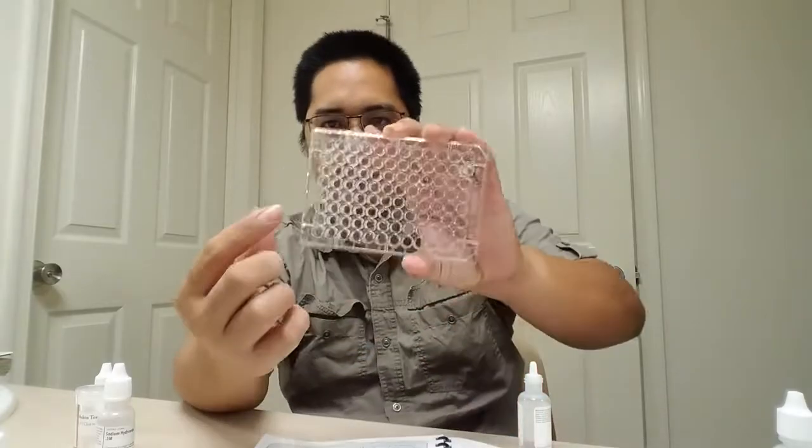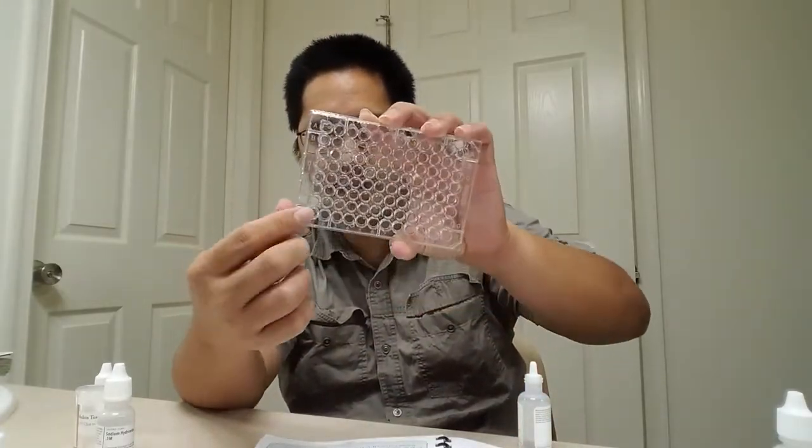All right, here we go. 5 drops. 1, 2, 3, 4, 5. 1, 2, 3, 4, 5. You might want to go a little bit slower than that. I've gotten pretty good at these, but make sure you're exactly precise.